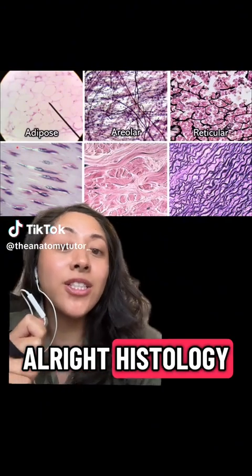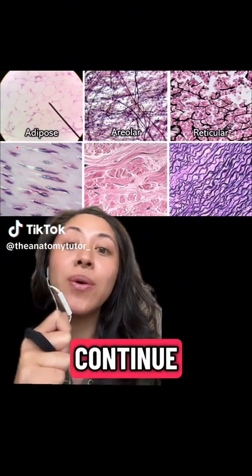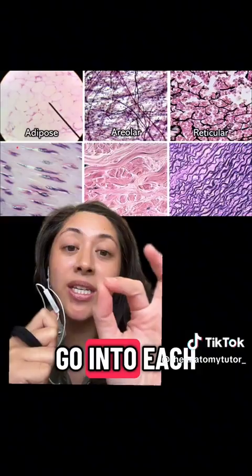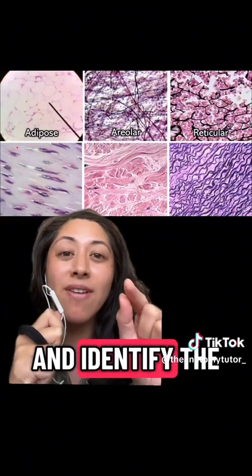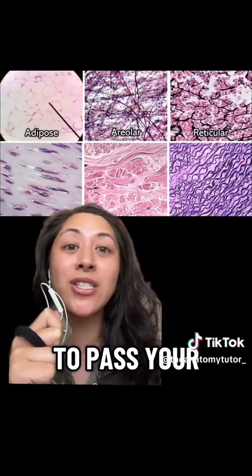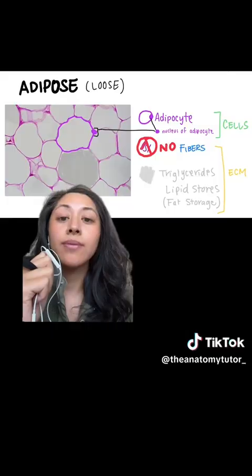All right, histology, connective tissue. Let's continue. This is connective tissue proper. There are 6 different types, and we're going to go into each of these and identify the different structures inside that you as a student are required to know in order to pass your lab class. So let's get into it.